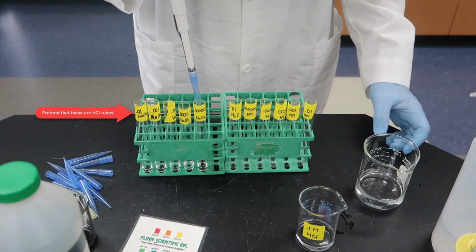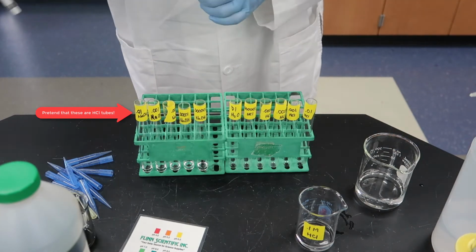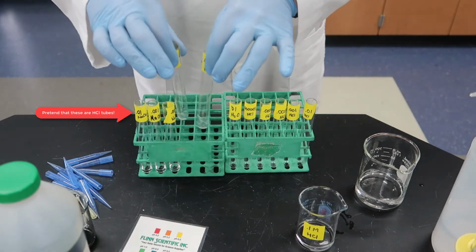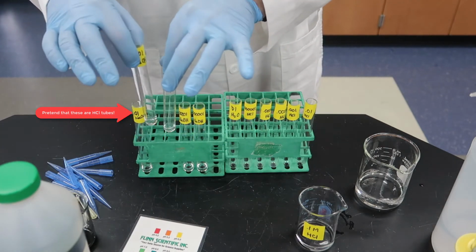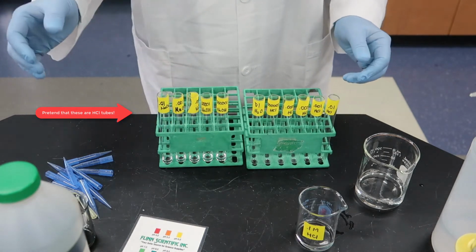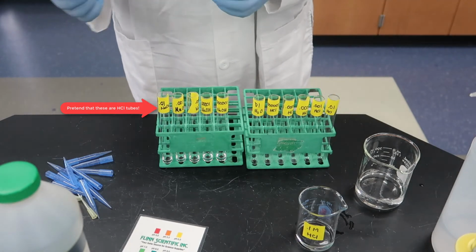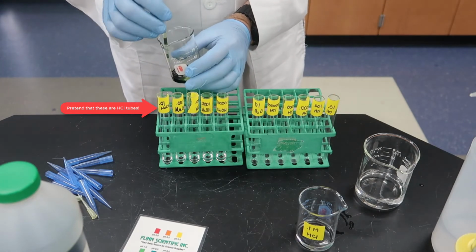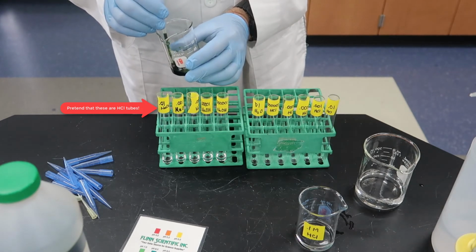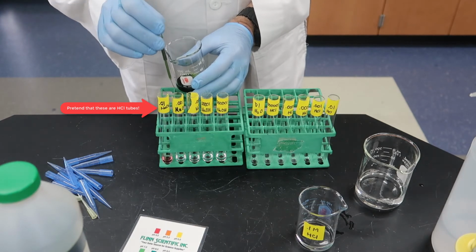And since hydrochloric acid is a clear solution, they don't look any different. They all look the same. You can't really tell just by appearance. So what we're going to do is use the universal indicator, a neat chemical that changes color based on the pH. So as we go through each of the tubes, we're going to add a few drops of universal indicator and see what happens. And it doesn't really matter how much you add. All we're really doing is trying to get a color change. So we'll just put a couple of drops in there and see what we get.